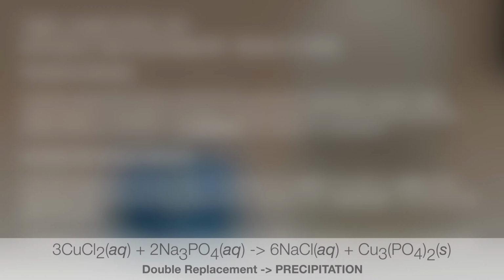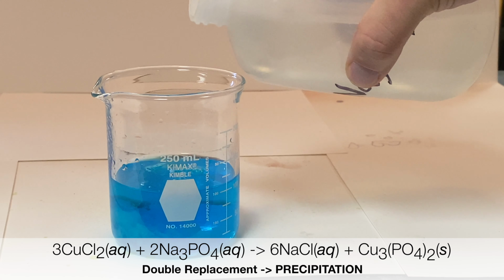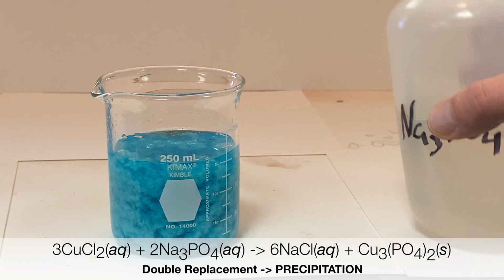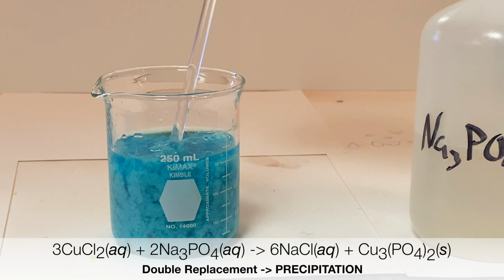Let's take a look at an actual precipitation reaction. Here is an example of a precipitation reaction between copper chloride solution and sodium phosphate. You can see that when the two solutions are mixed together, a solid falls out of solution. The products formed are a solution of sodium chloride, which is of course soluble in water, but a solid that can't dissolve, called copper phosphate.